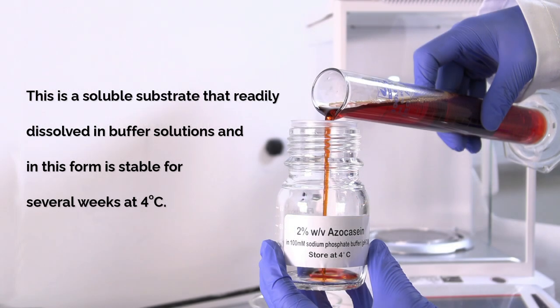This is a soluble substrate that readily dissolves in buffer solutions and in this form is stable for several weeks at 4 degrees Celsius.